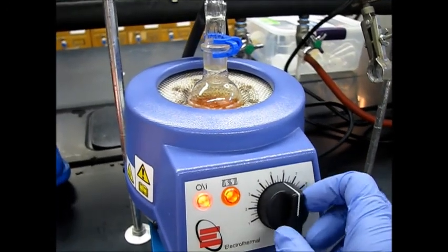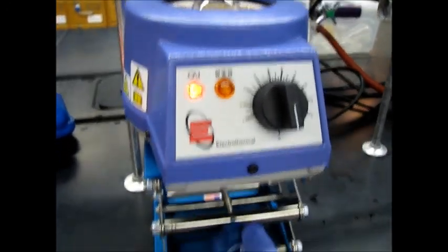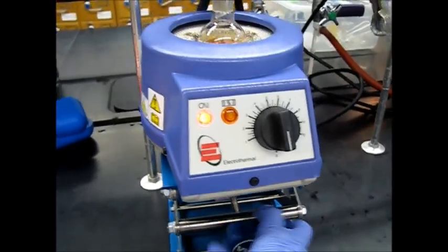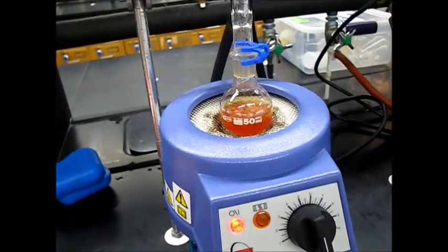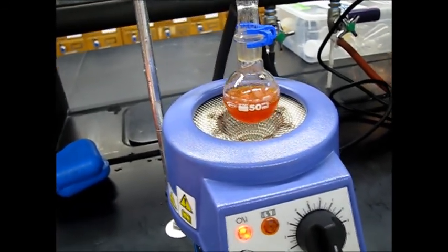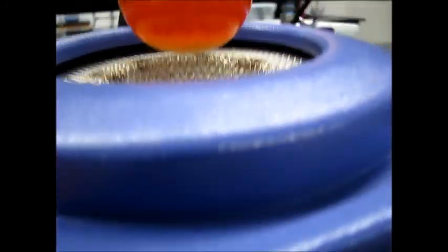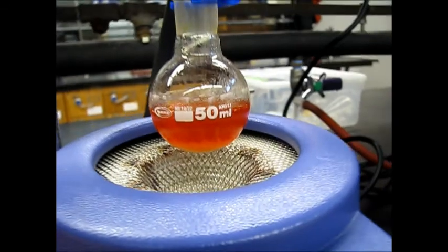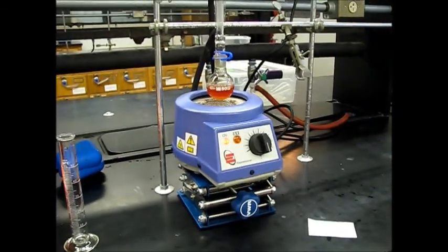Now we can stop the heating. And here you can see everything is dissolved. Only few chunks remain. That's okay. Now wait for it.